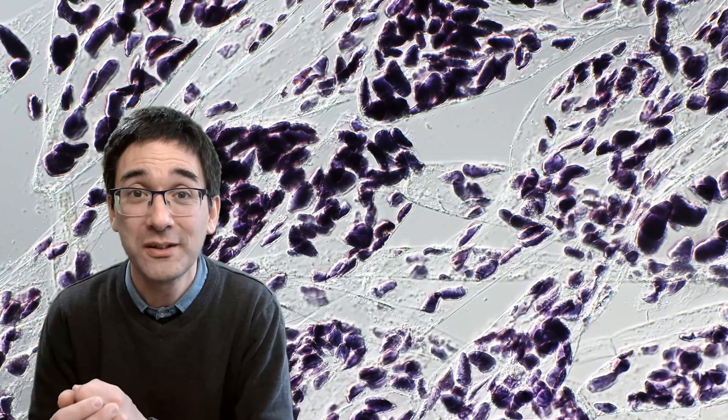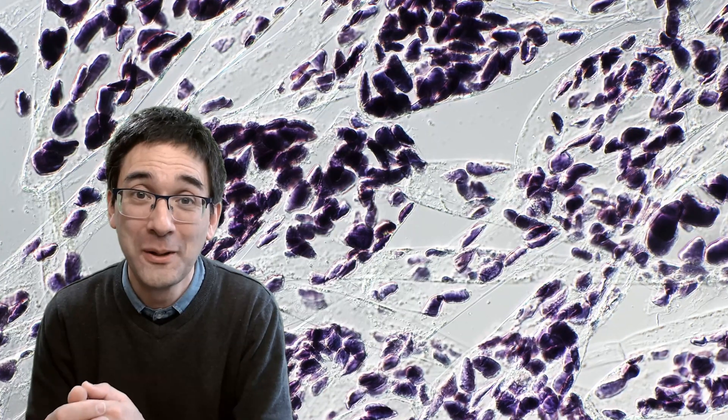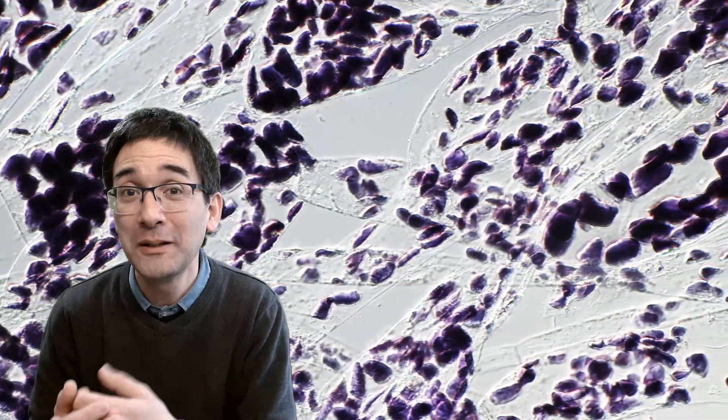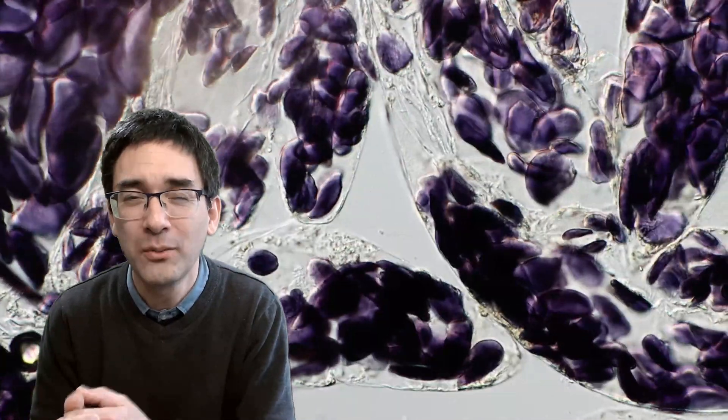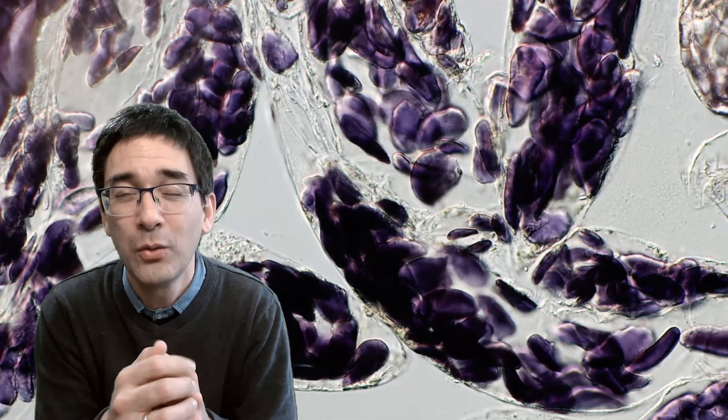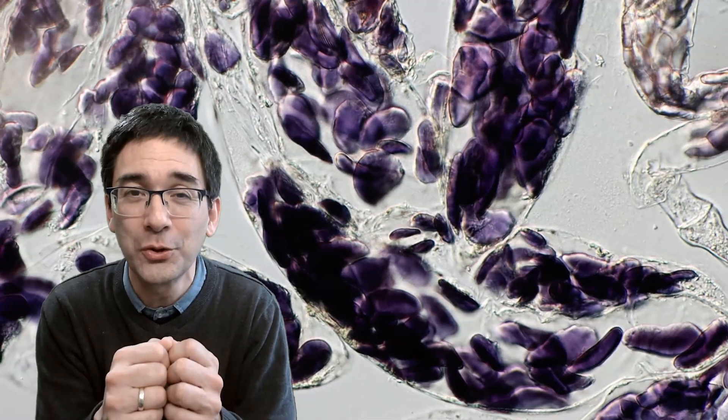Today in this video I would like to show you how you can prepare those granules yourself if you have a microscope at home. I'm also going to talk a little bit about starch itself and why starch is used to store energy by plants. Why don't plants just store the glucose that they made by photosynthesis? Why do they bother to convert it to starch? I'm going to talk about this later.